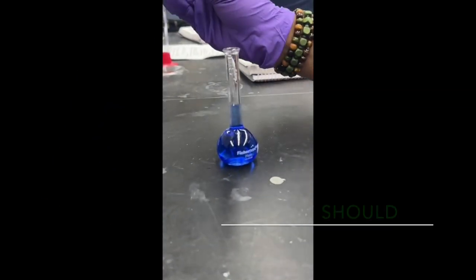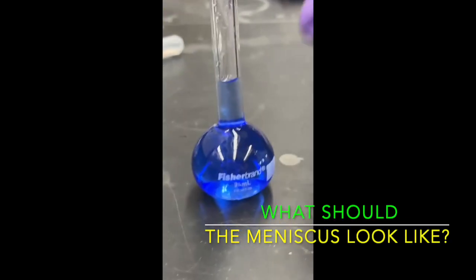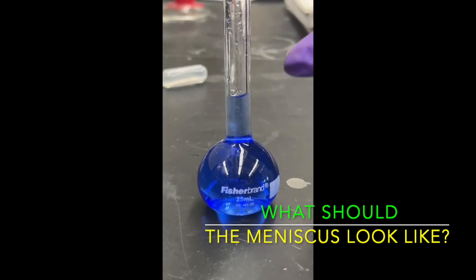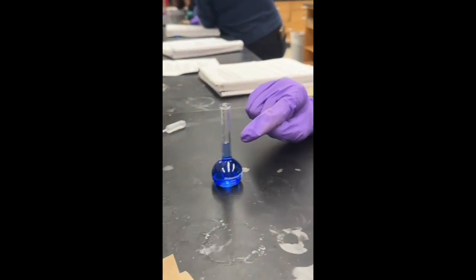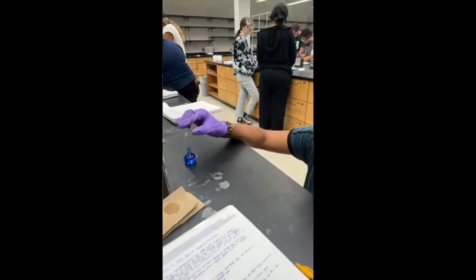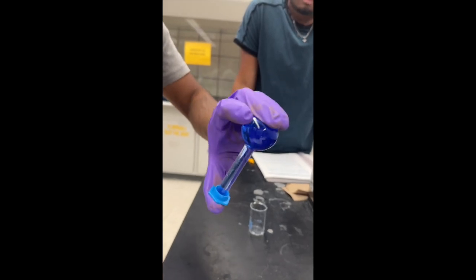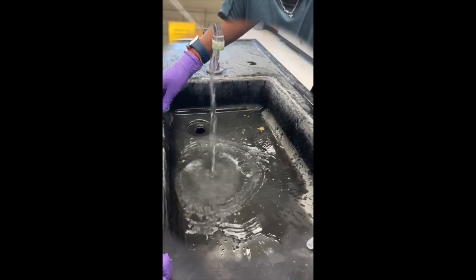Look, zoom in at the meniscus. The meniscus should be about the 25 milliliter mark, like it is right here. The bottom of the meniscus is what you're trying to measure. It's currently at the 25 milliliter mark, so it's good. Okay, now we're inverting the flask and gently mixing it.